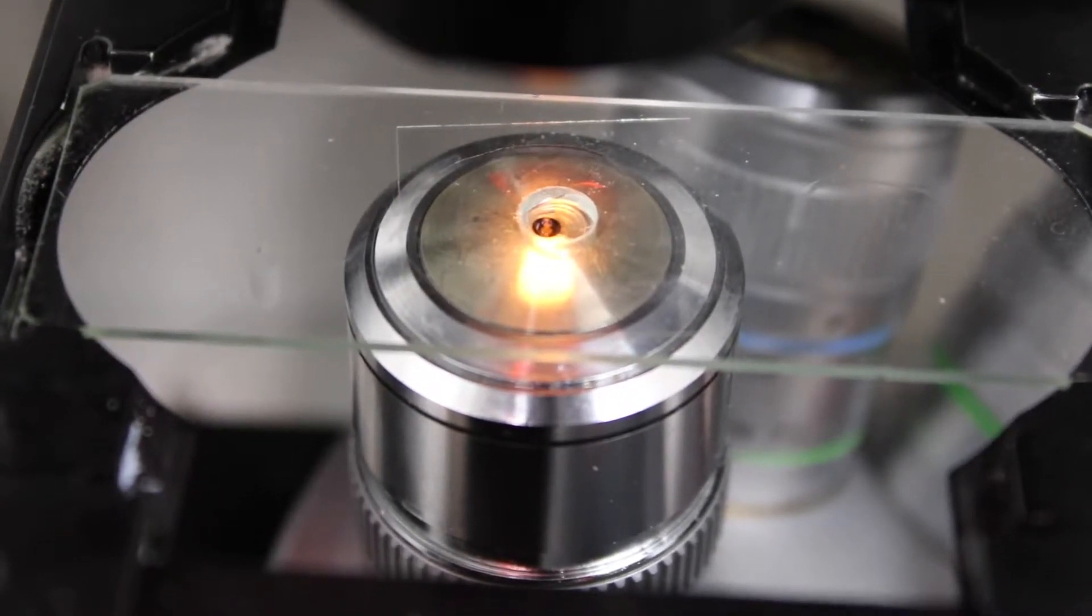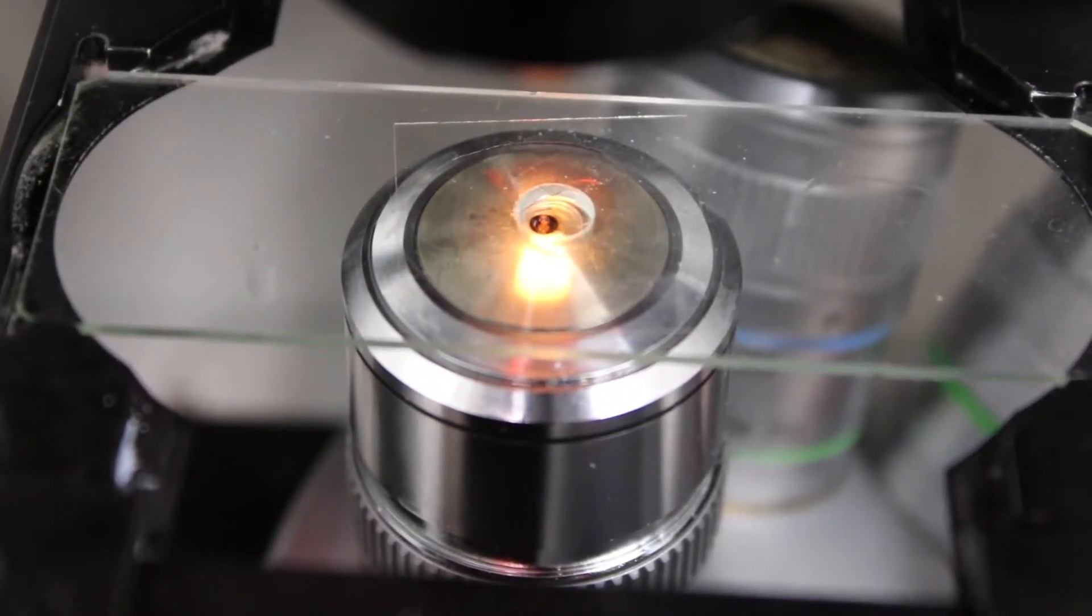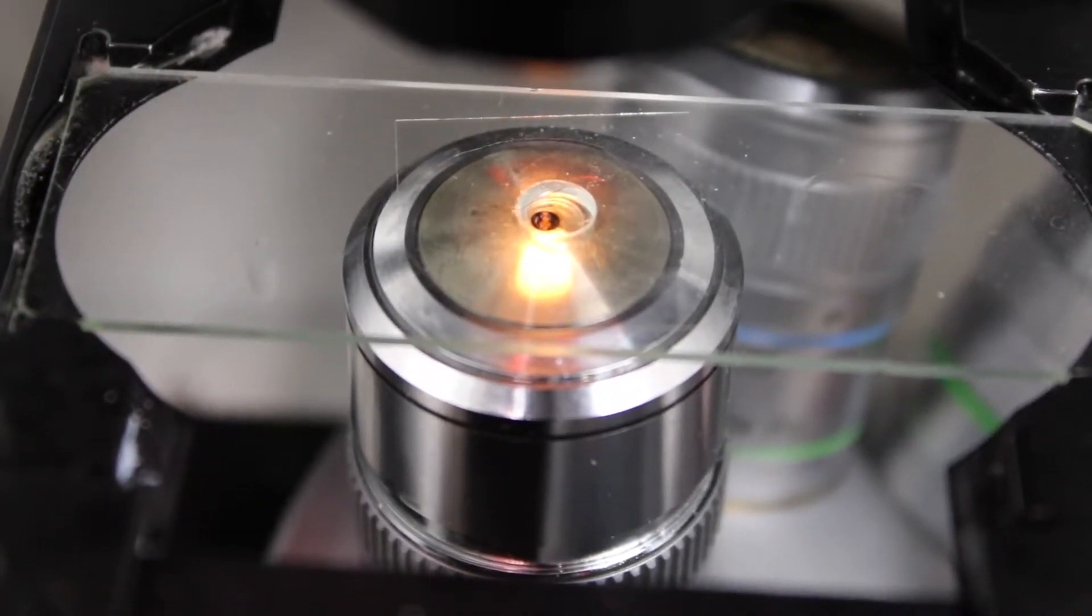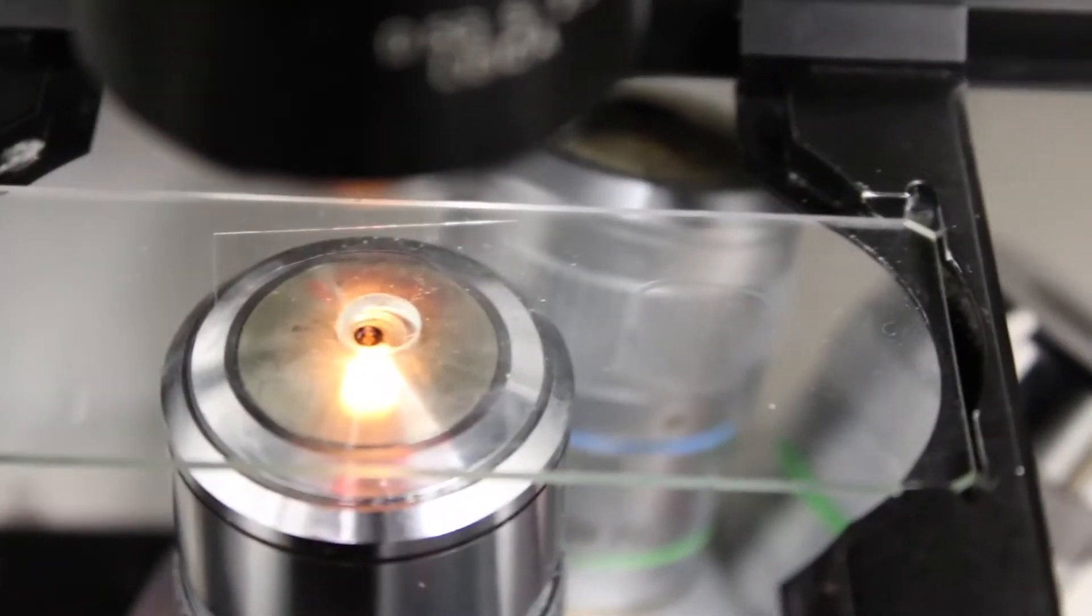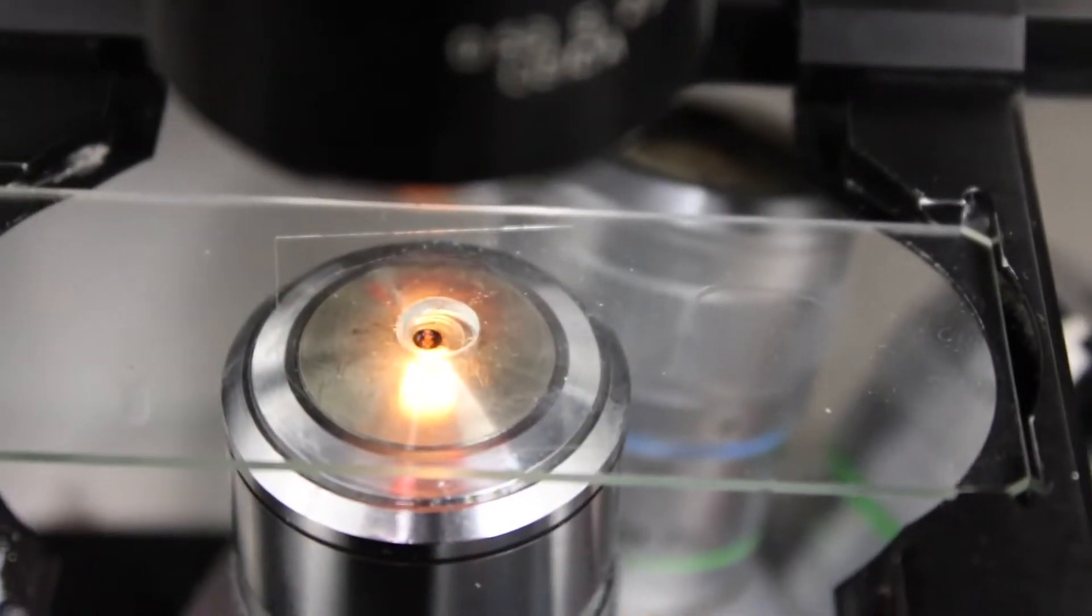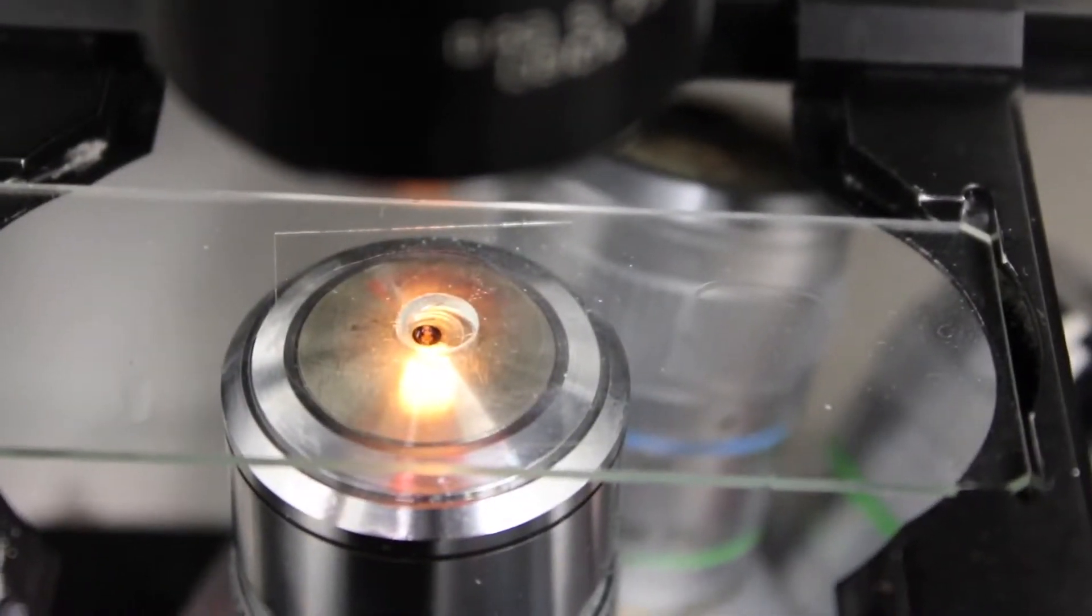That means that you've reached the right position, and then you can adjust more finely the focus.